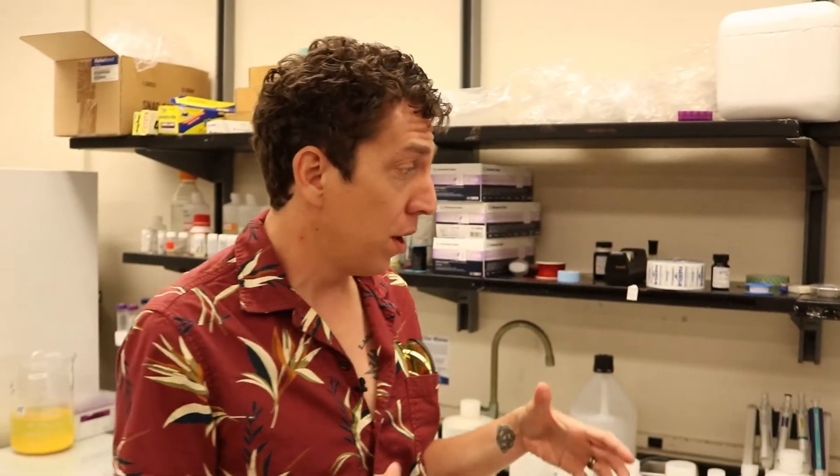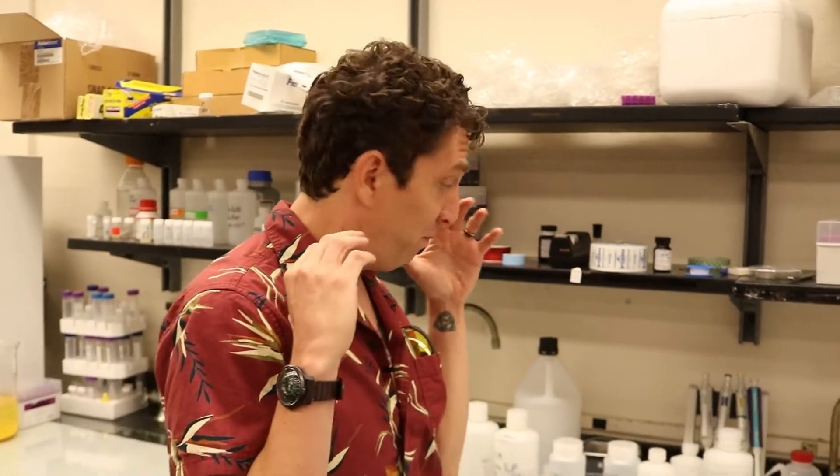Hey everyone, my name is Chris Anderson and I'm here today with Abdul, who's going to explain to us how they grow carbon nanotubes. So Abdul, walk us through the process of how you grow these things.